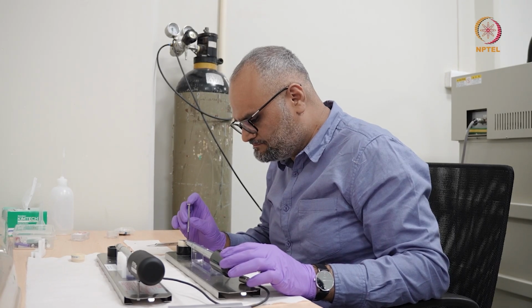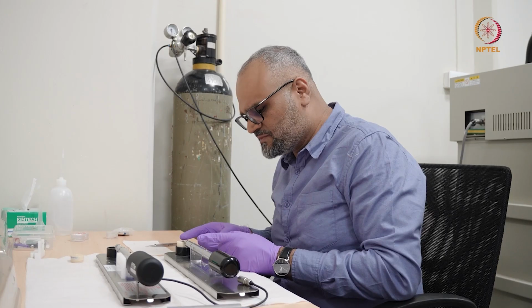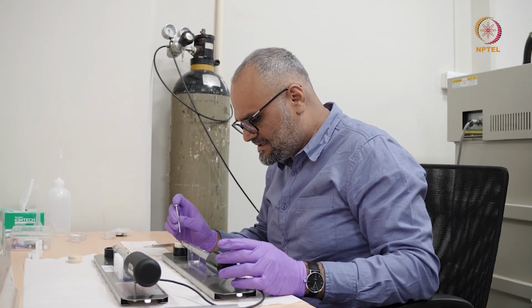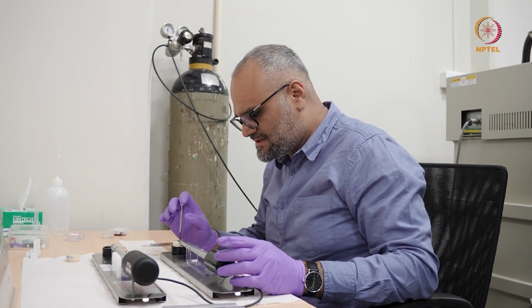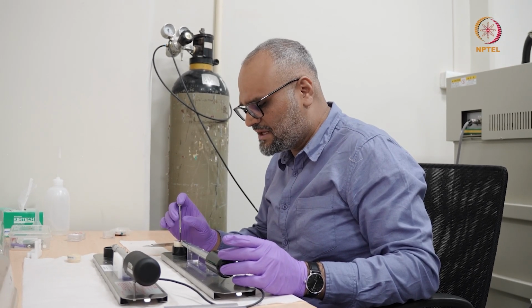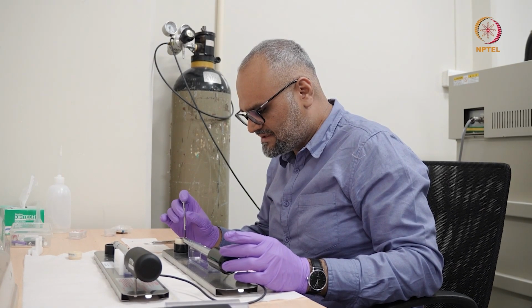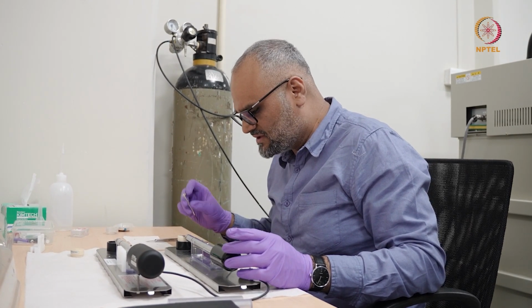And bear in mind, always put your gloves on. This portion which goes into the microscope column should be absolutely clean, and the specimen rod in general also has to be clean. And while you're applying a torque on the screw, I generally do not recommend using the index finger, because you can end up applying too much torque. So place your finger on the top and then gently just do it finger tight, just to be sure that you do not damage any of the sensitive parts in the holder.